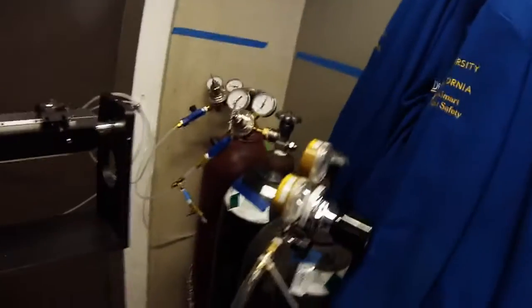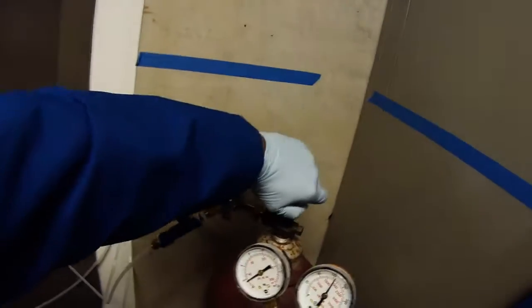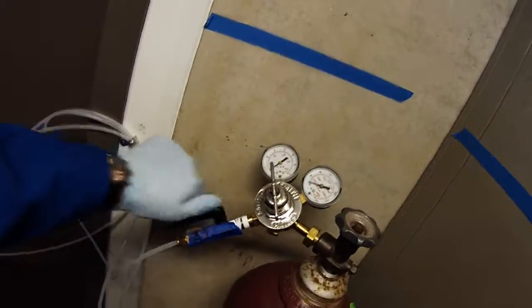With evaporation mode you just need to turn on the nitrogen, but with sputtering you need an additional gas - the actual source gas for the plasma. With sputtering you feed a gas into the chamber, and using the gun you light that gas into a plasma. That plasma is driven by magnets onto the target, the target ejects material, and that's how metal is deposited onto the substrate. The gas we use for the Orion is argon.